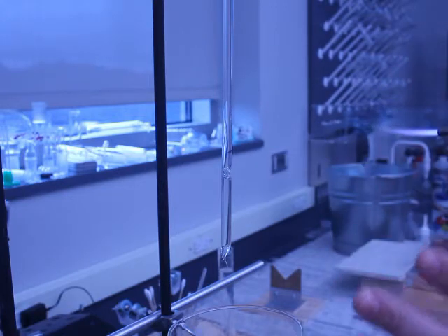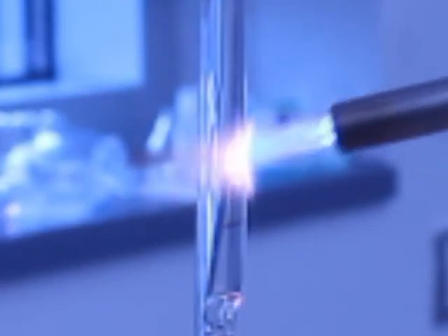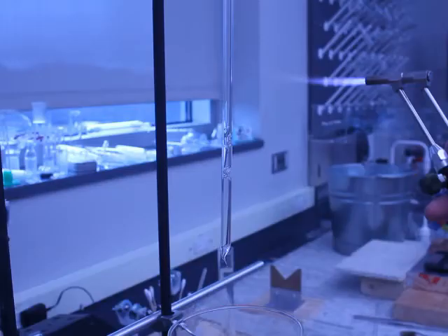Okay. Now, if I come in because I'm impatient, look at how that bubble of glass is sucked in. If it wasn't for the fact that just out of habit I pulled away, within a fraction of a second, that glass would have popped. Up here. Oh, look at that. So you can see how that fragile little bubble of glass is still... one more time. There it goes.